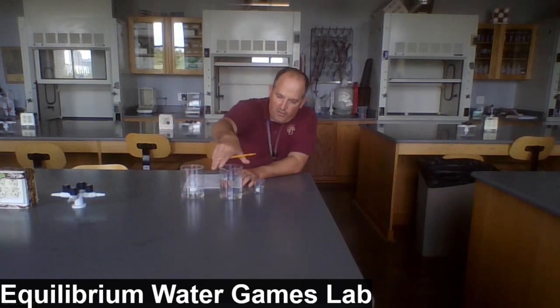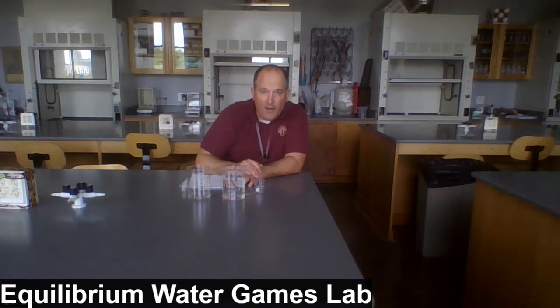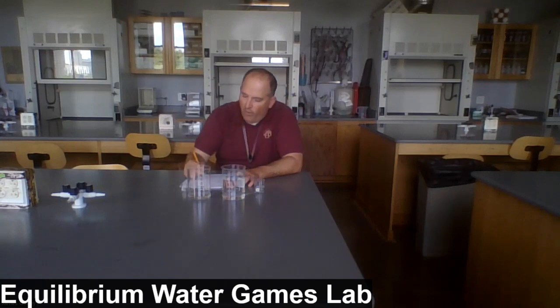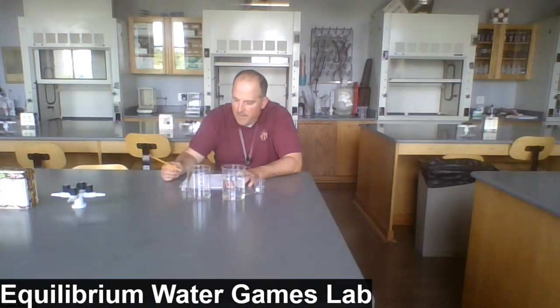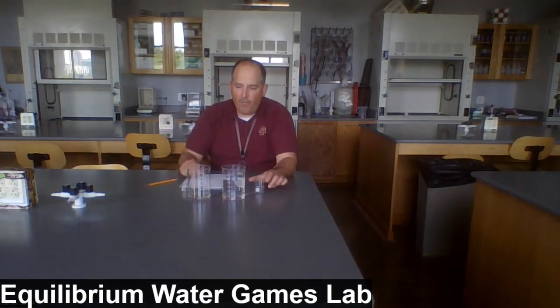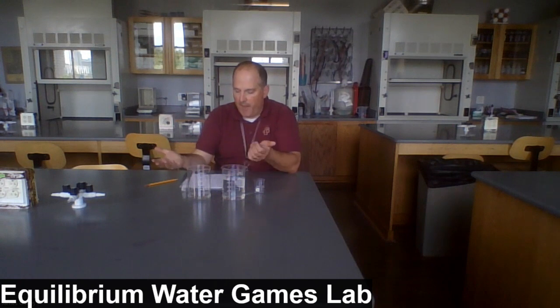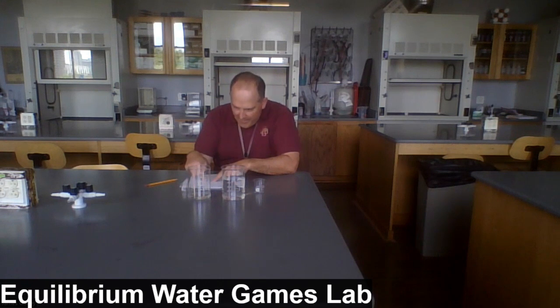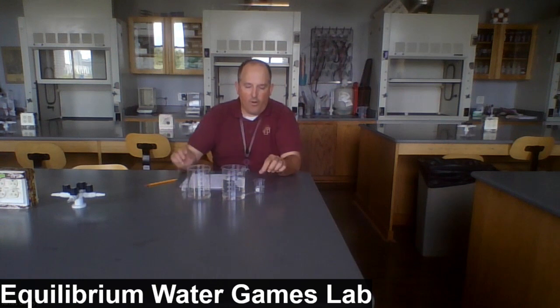Let's record the volumes. After completing that transfer, and I'm kind of roughing this in, we're using the volume markings on the side of the beaker here. I'd say we have 450 milliliters of water in beaker A and about 80 milliliters of water in beaker B. And don't worry if the numbers don't quite add up to 500, like right off the bat I'm saying, hey, wait a minute, somehow the total of water right now is more than 500. It's all going to work out in the end, so don't worry about that.